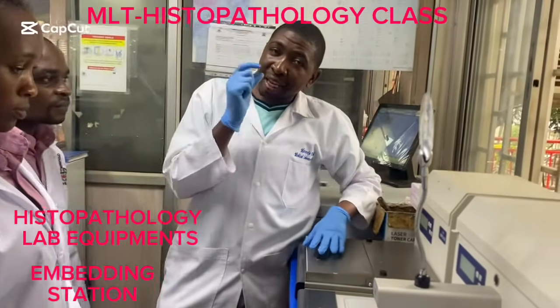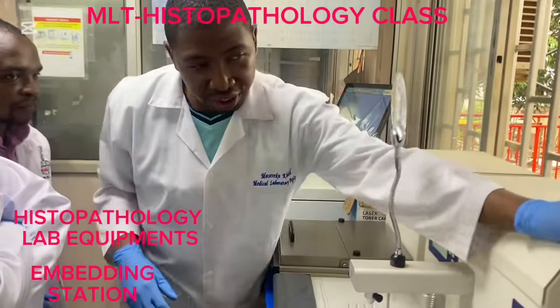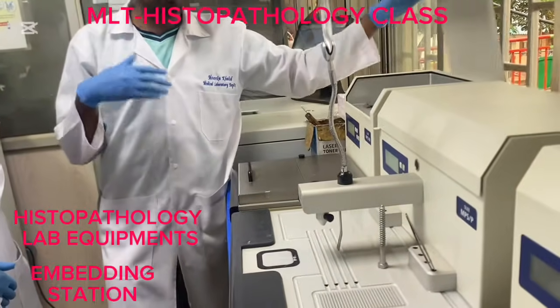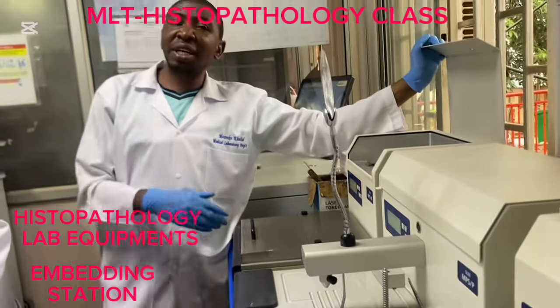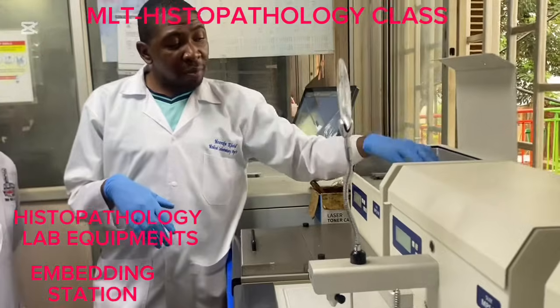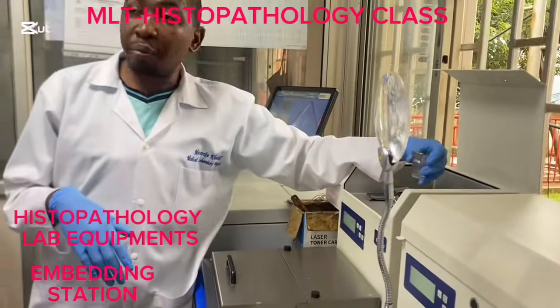Embedding, the major aim is to form a tissue block. So the embedding station has different components or parts that help us to perform the whole embedding process. So we can call it embedding, blocking, or casting. So number one, it has a compartment for embedding molds.